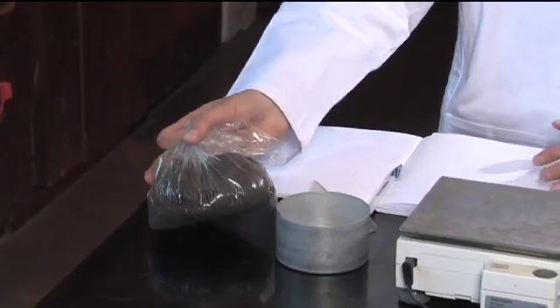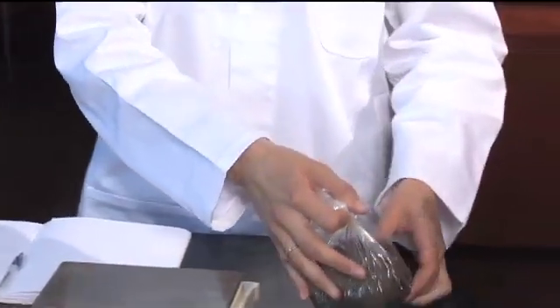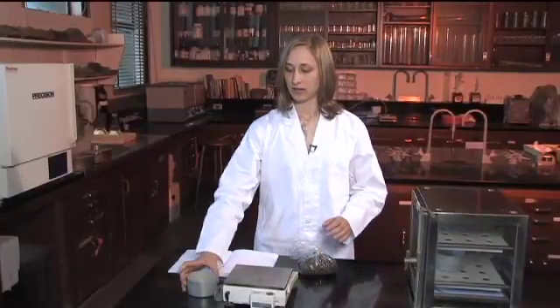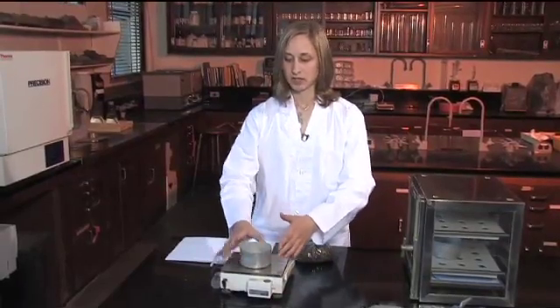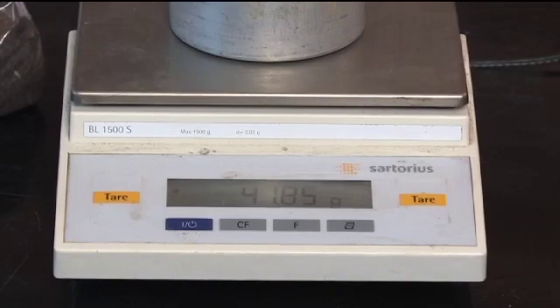You want to bring your samples straight from the field so they're fresh and the moisture content hasn't changed. You use moisture tins to weigh out some of the sample. Record the weight of the moisture tins before you put the sample in.